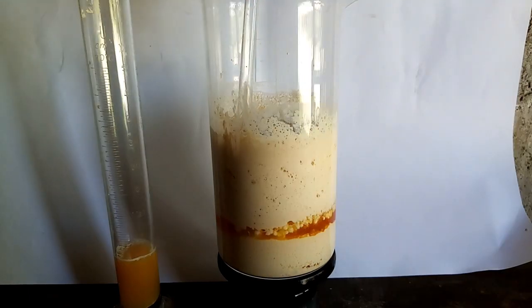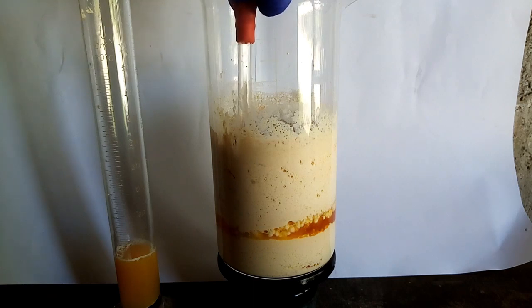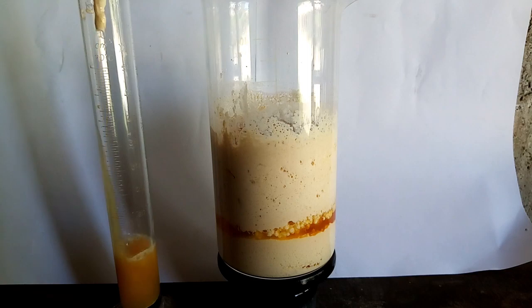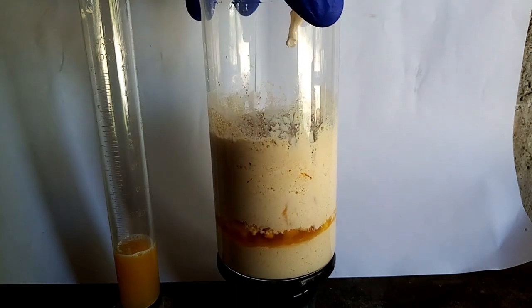At the end, the nitric acid layer that was forming in the beaker became much smaller, which made me suck up more calcium sulfate, causing the acid from the graduated cylinder to become cloudy.